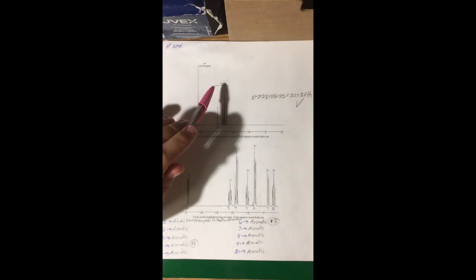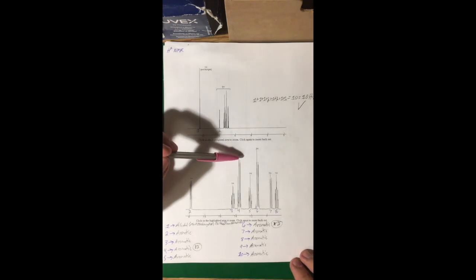As you look at our proton NMR here, I'm going to make sure that we have the amount of hydrogens. First one up here, 1. These are so condensed together, so I made another graph of it. Got one here, 1. This one signaled a 2 due to its height. Another one here. This one's also 2 due to its height, and then 1 here. So got that 1 up here, and then these 9 equals 10. That's how much we had in the molecule.